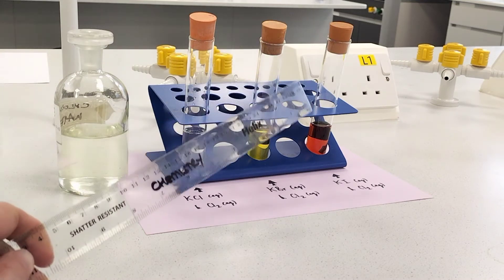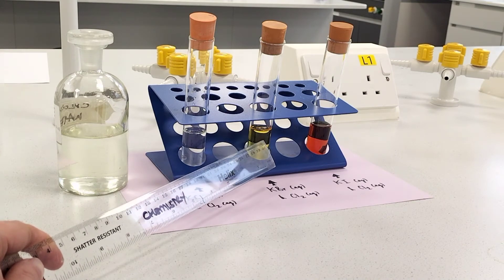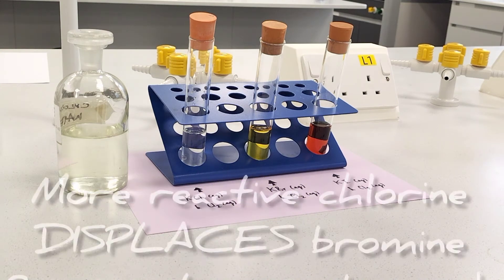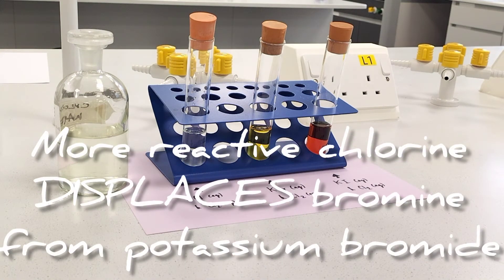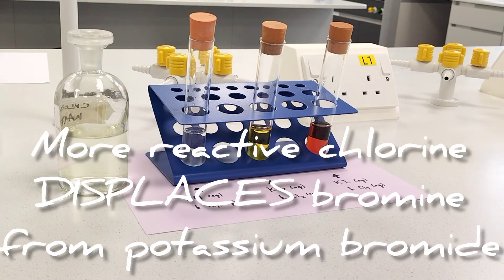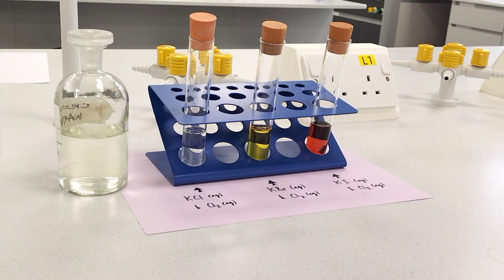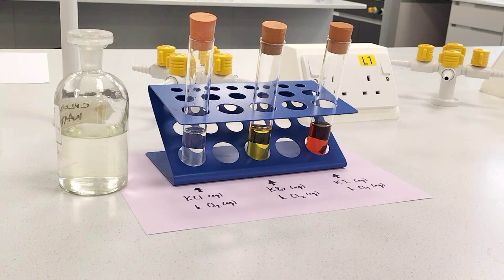On the other hand, when I added the chlorine water to potassium bromide, it went from being colourless to being a yellow colour. That's indicative of a displacement reaction — the more reactive chlorine has displaced bromine into solution from the potassium bromide. The solution appears yellow because there is bromine dissolved in the water, and dilute bromine has a yellow to orange appearance.